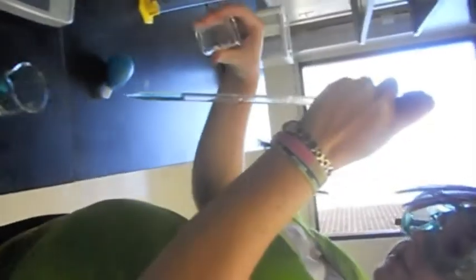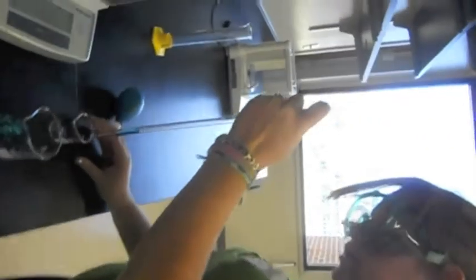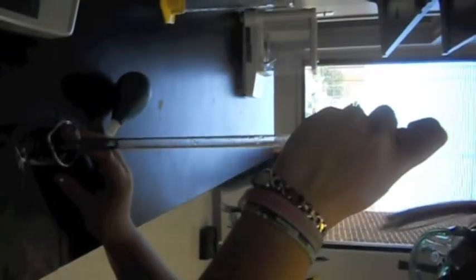Then you take a different beaker, slowly release some of the water, then place your finger back on the top.